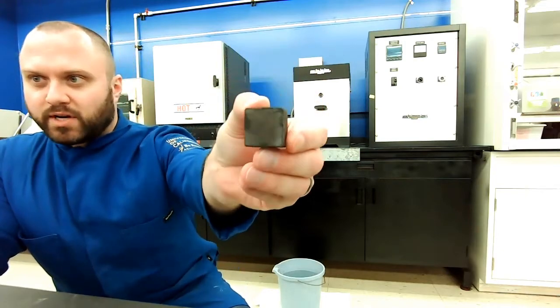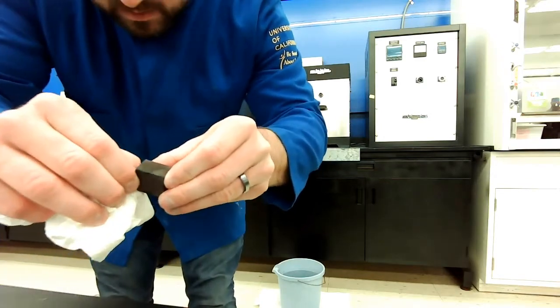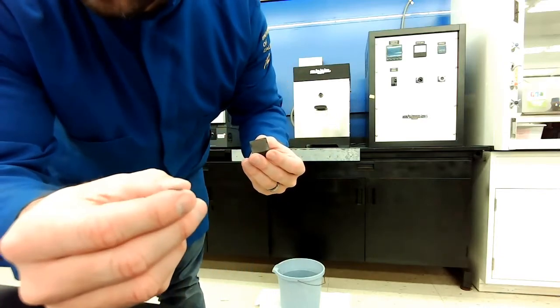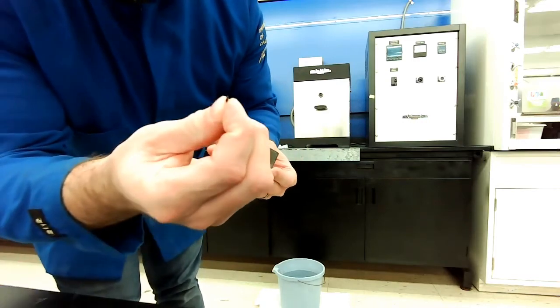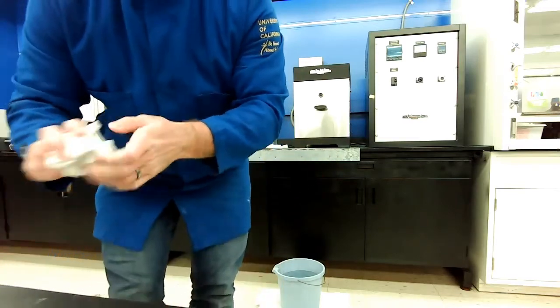So you can see it's still pretty dirty, but find a piece that just flaked off. So a piece of that oxide flaked right off the surface. Okay. Let's pull another one off the surface too. So we have 2 of our 3 samples.